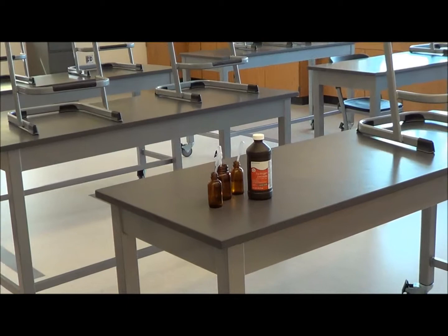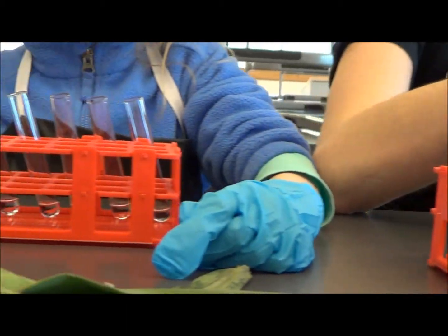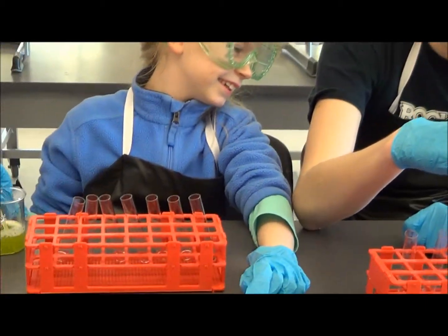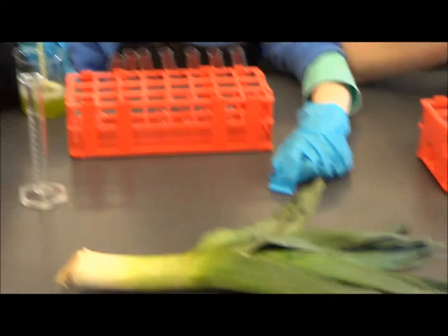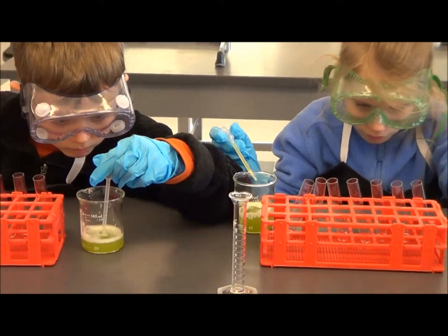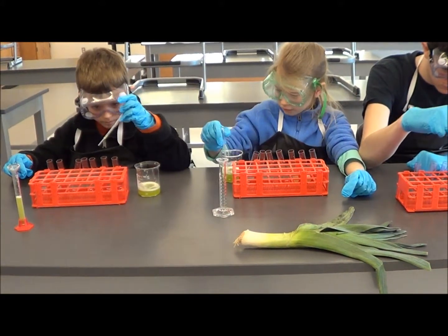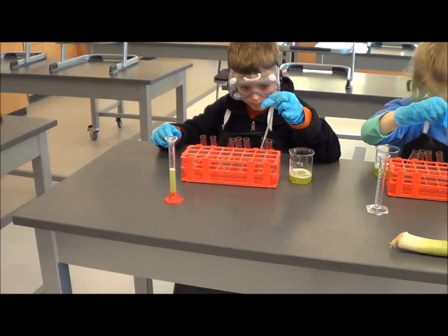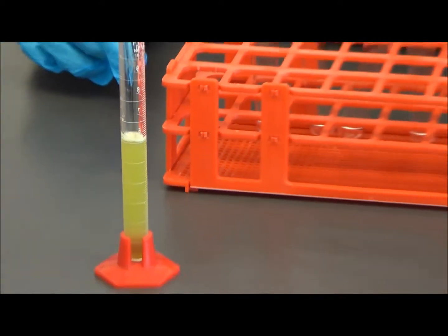We finished with the hydrogen peroxide step and now each of the test tubes has one milliliter of hydrogen peroxide in it. In test tube zero we put zero mils of this catalase that came from the leek. In the first one, in the second one, we put in - it says one on the test tube - we'll put in one mil. Go ahead folks, you can get started. At the very end when we get to five or six we might want to use this graduated cylinder to measure that out because it's going to be kind of a lot.